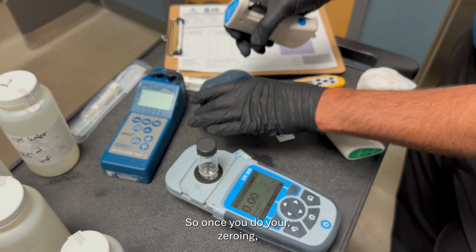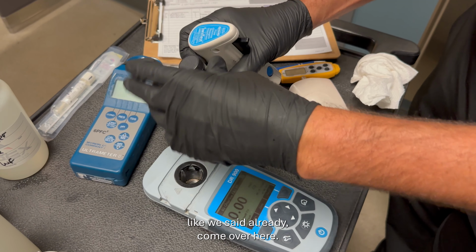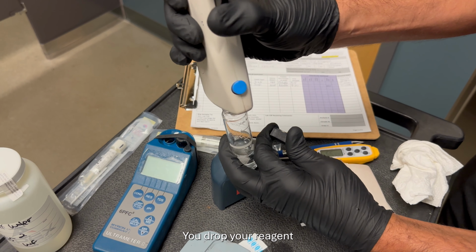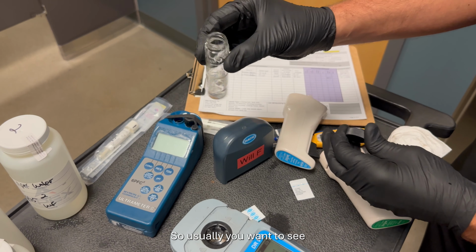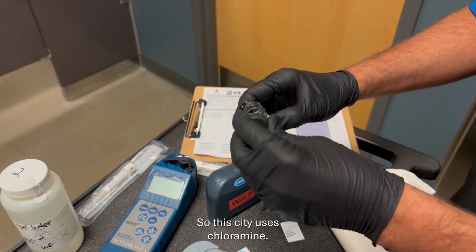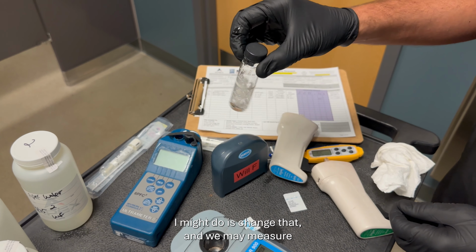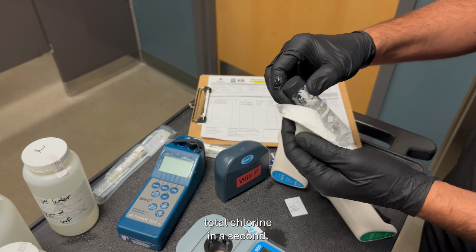So once you do your zeroing, like we said already, come over here, you drop your reagent inside. Usually you want to see it turn a pink color. So this city uses chloramine, so what I might do is change that, and we may measure total chlorine in a second.